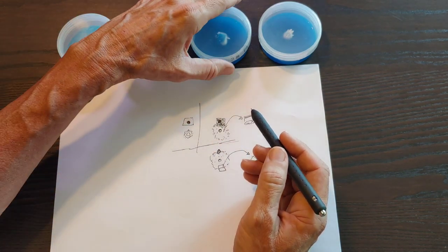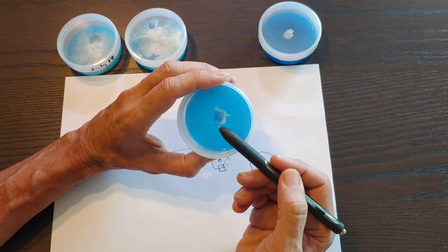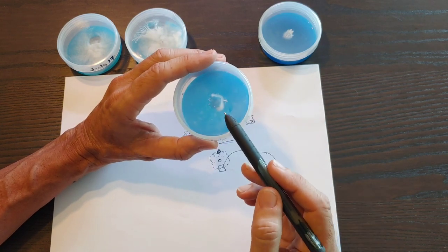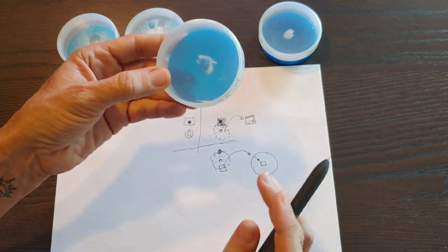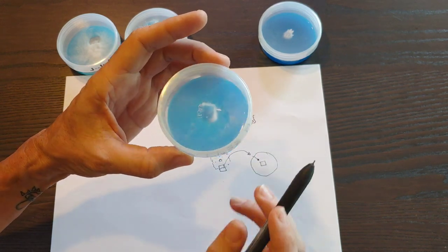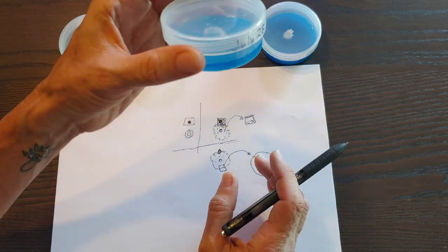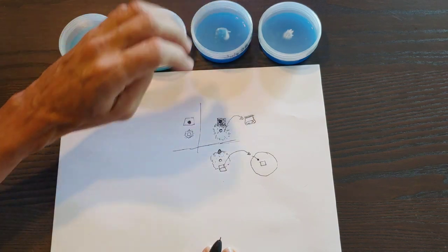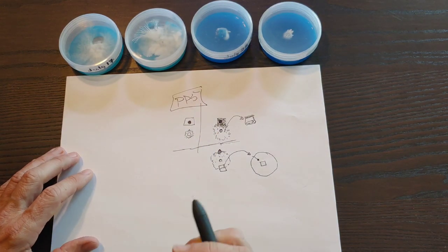To begin, just start by buying your own plates, your own Petri dishes. They have to say pre-poured, because if not, they show you that it has agar in it, but they come to you empty. Because it doesn't say pre-poured. It just says, oh, agar dishes, and a bunch of pretty pictures of scientists using it with agar inside. And when you get it, it doesn't have any agar. It hasn't happened to me, but it almost did one time. I was like, oh, wait, this doesn't say pre-poured. And when I looked closer, it wasn't. It was empty dishes. So if you're going to buy them empty, buy these that are reusable. And I also have those in the tools and materials list. They have to be PP5, which is a plastic that'll take the heat and you can reuse.